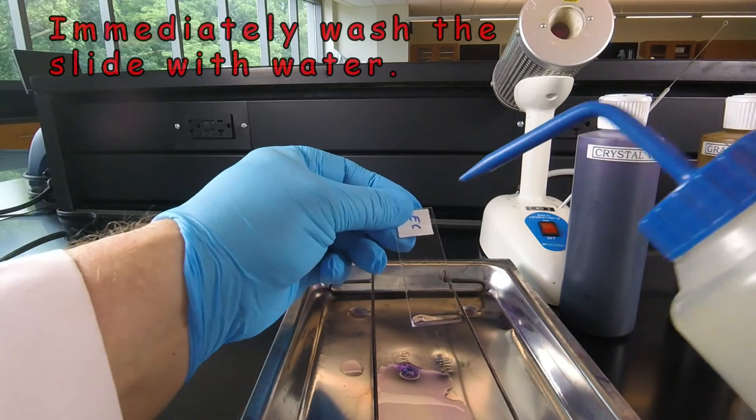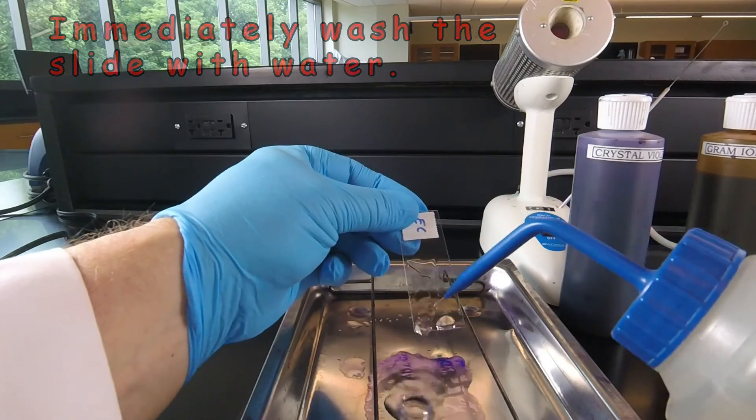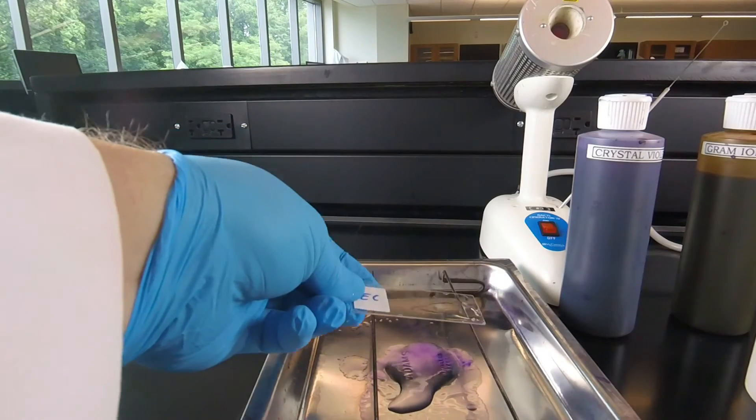So we're going to immediately pick up our water bottle and wash with deionized water. And then we can go on to the final step, counterstaining with the safranin.